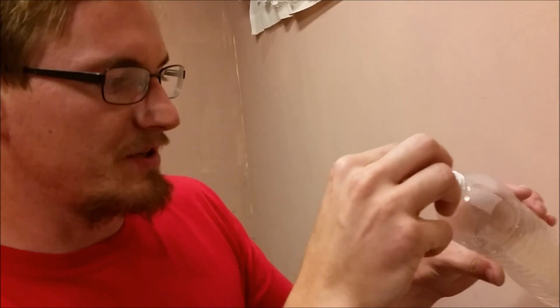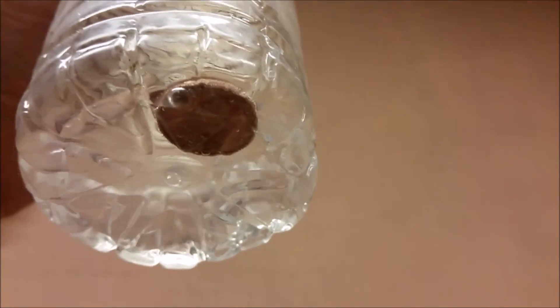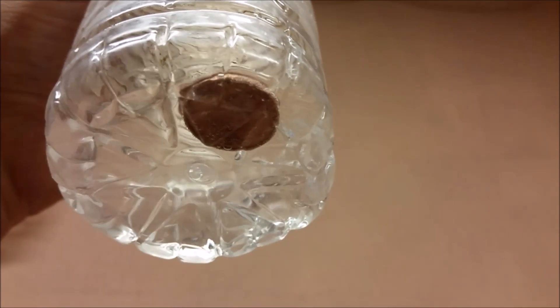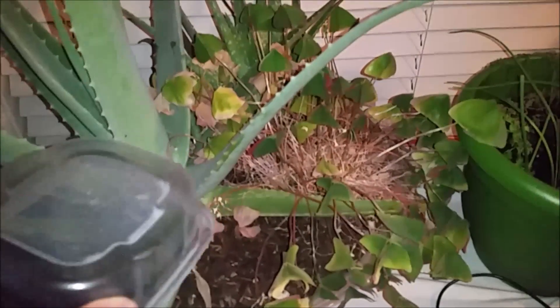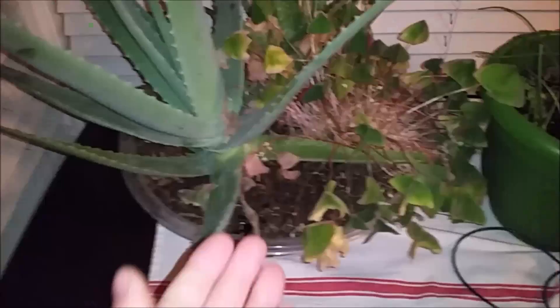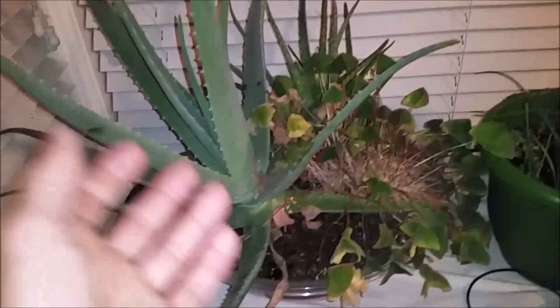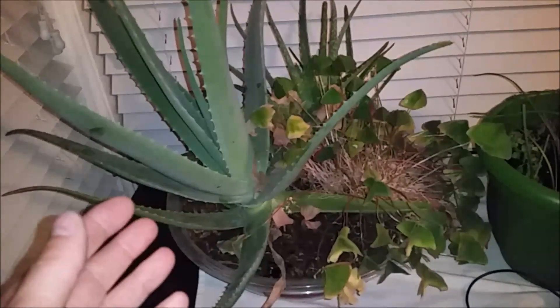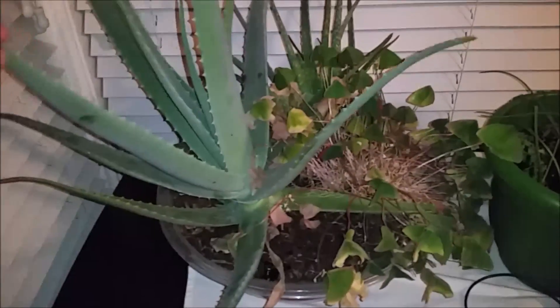Now we've confirmed that it is acid. Let's go ahead and do a check to make sure that it is nitric acid — see if it's reacting with the penny. Looks like it's reacting with the penny. Very nice. Now that I've reacted this nitric acid with the baking soda, I could add it to a plant — this is actually a good fertilizer. I could perhaps run this apparatus with a solar panel inside of a greenhouse and produce all the nitrates that I need for my plants.